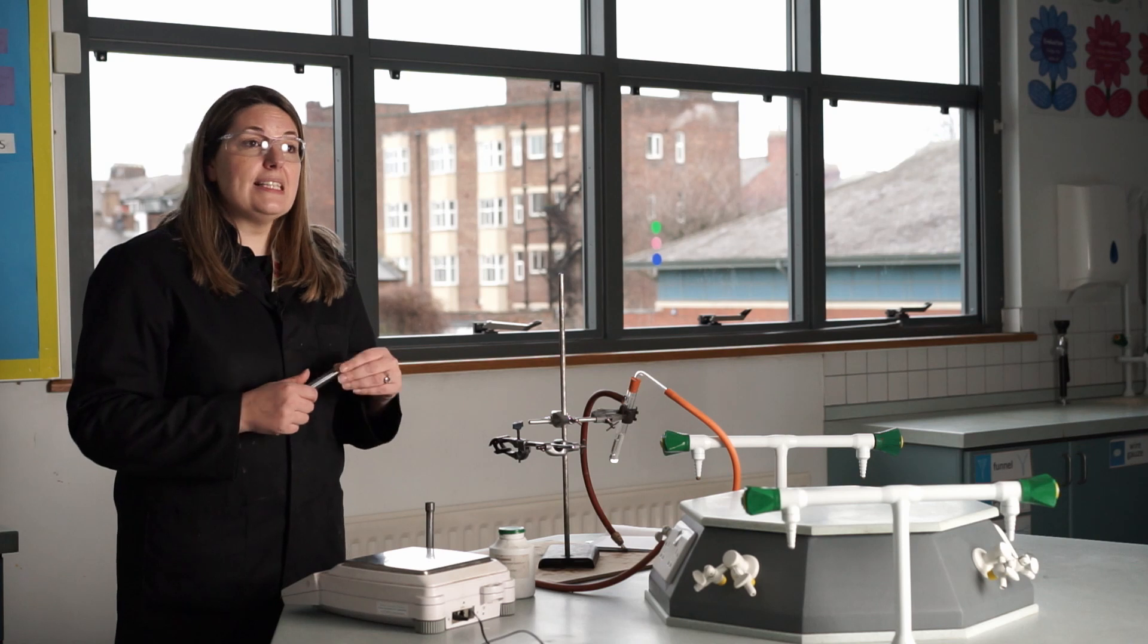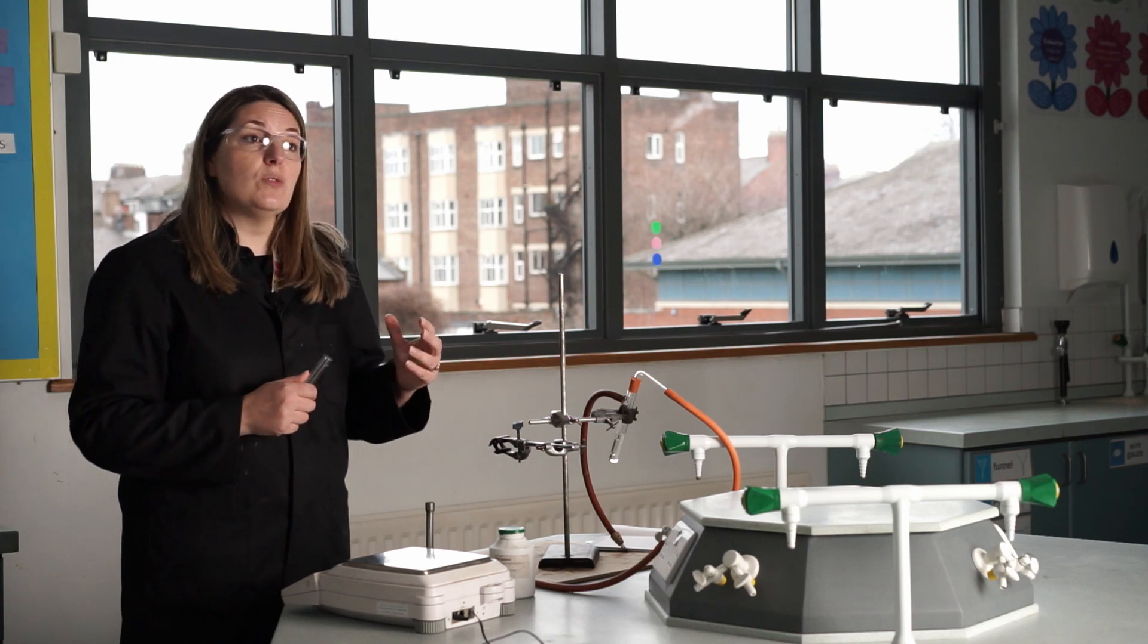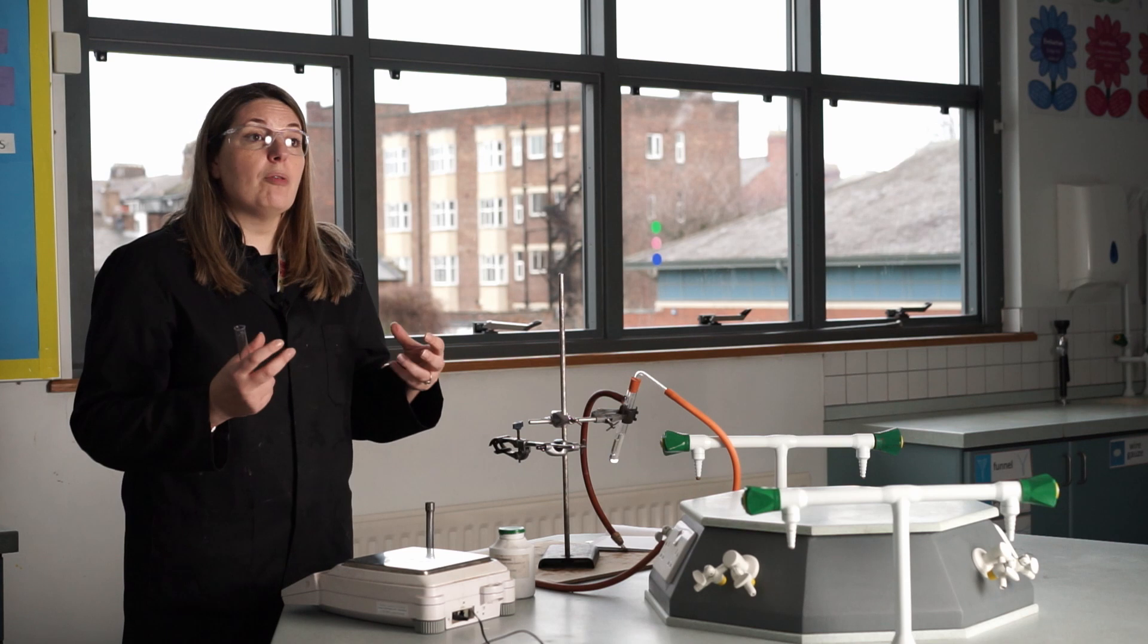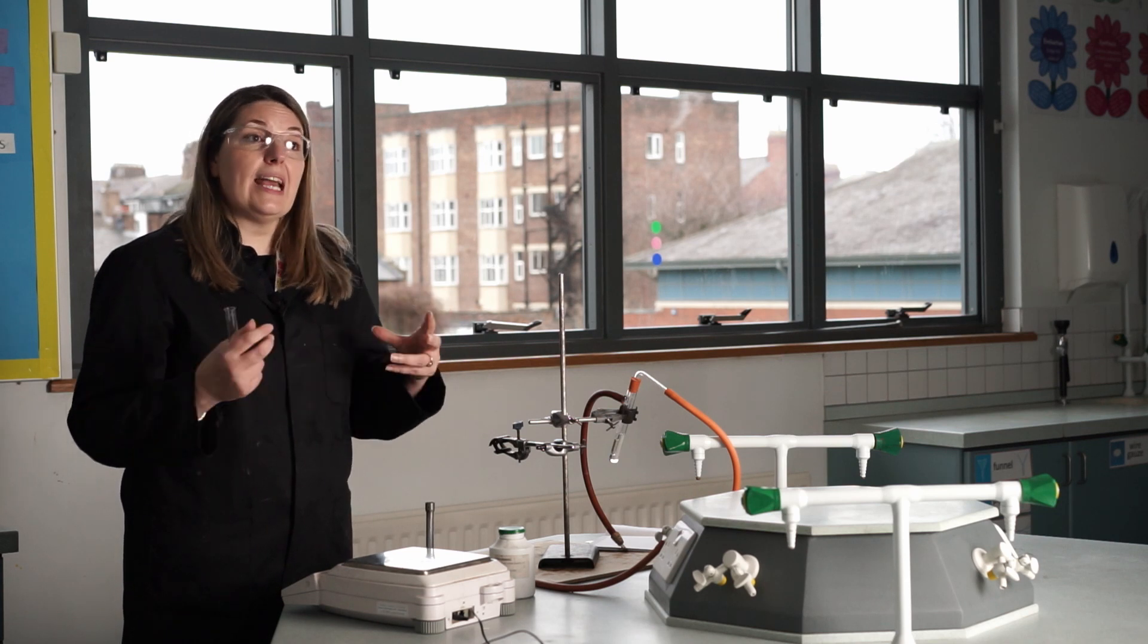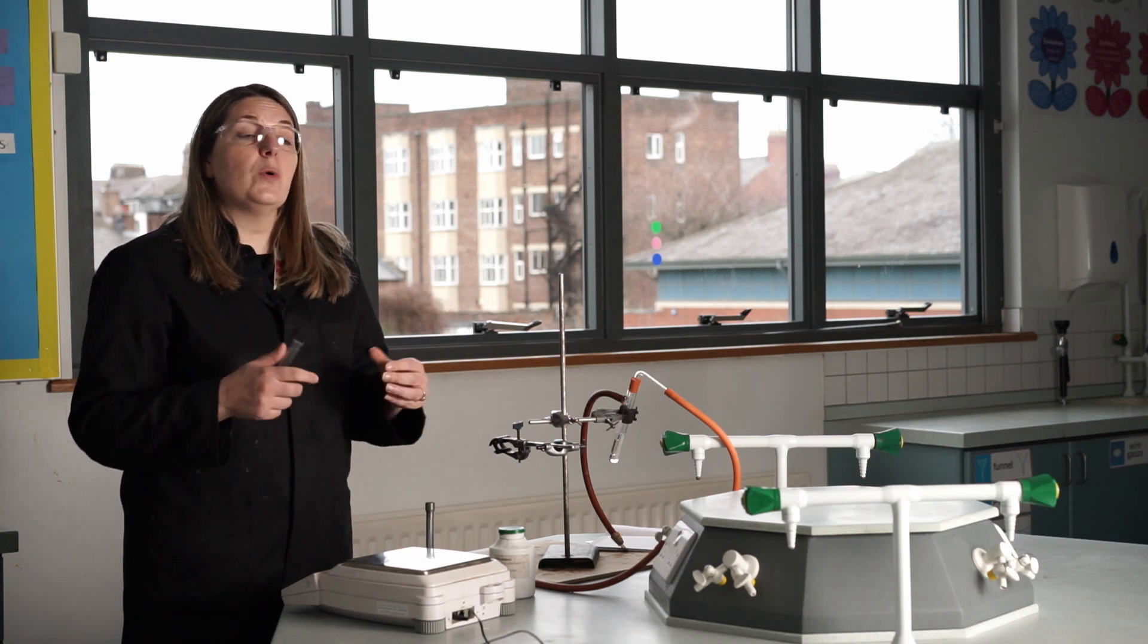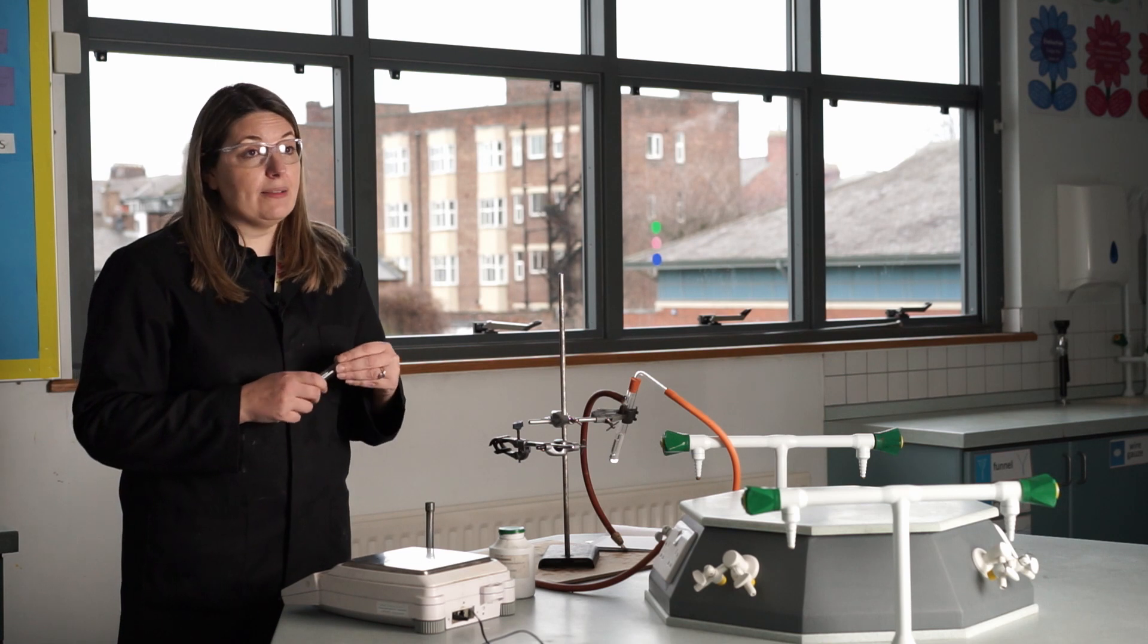Today we're going to do a slightly different experiment where we're going to reduce a compound. In this case, copper oxide, and we're going to reduce it. So we're going to take away the oxygen and work out the empirical formula that way. So it's slightly different.